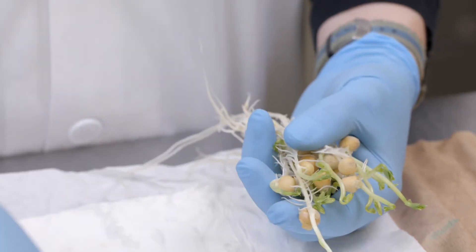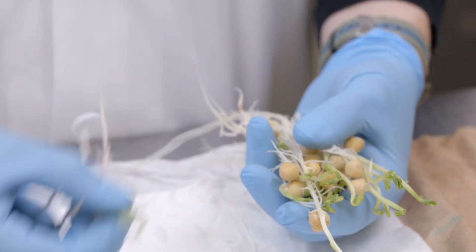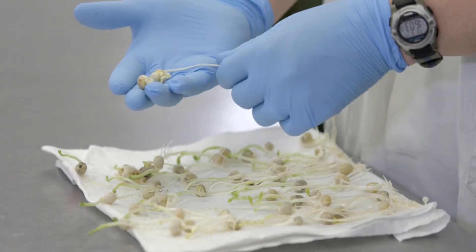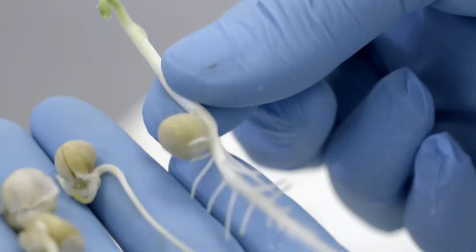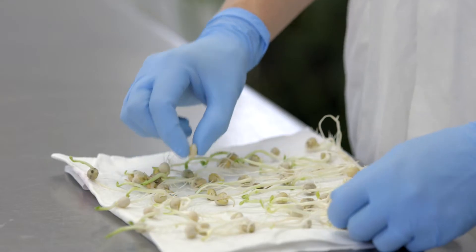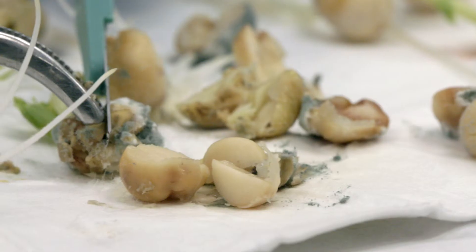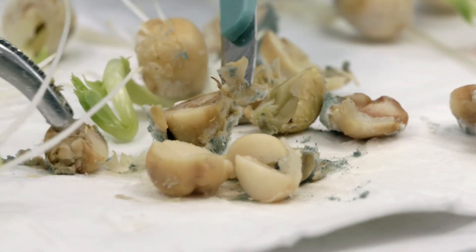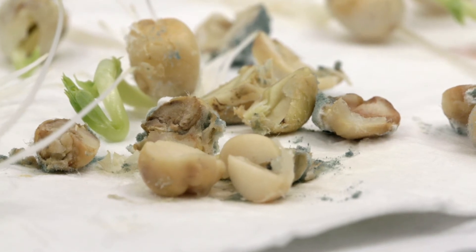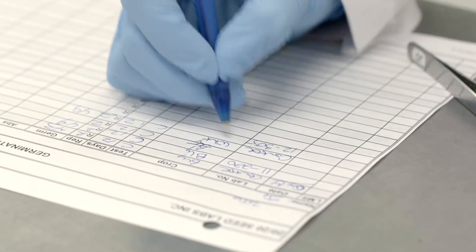The percentage of normal seedlings that are capable of developing into healthy plants are counted. Abnormal seedlings too — those that have one or more essential structures that are either damaged or absent — are also noted. And finally, dead or fresh seed that have no external symptoms of life are cut in half with a scalpel to see if they are viable, in essence alive or dead.